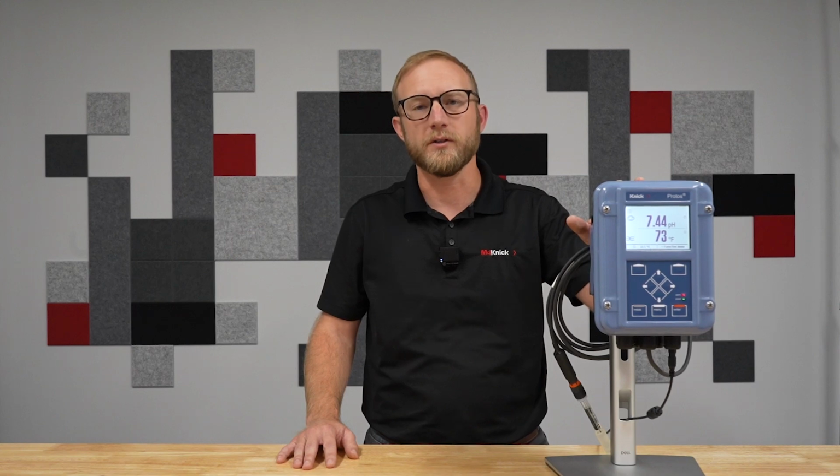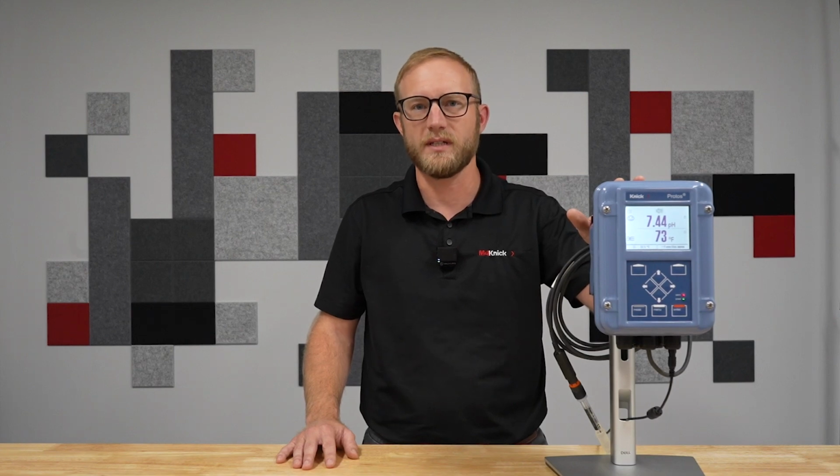Hello, this video will walk you through the process of activating the user-definable buffer set within the Protos 3400 transmitter. We will first activate the TAN code, or transaction number, and we will then walk you through the process of inputting the different buffer values at certain temperatures.